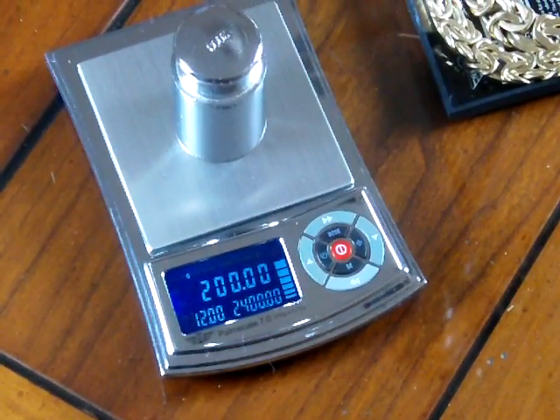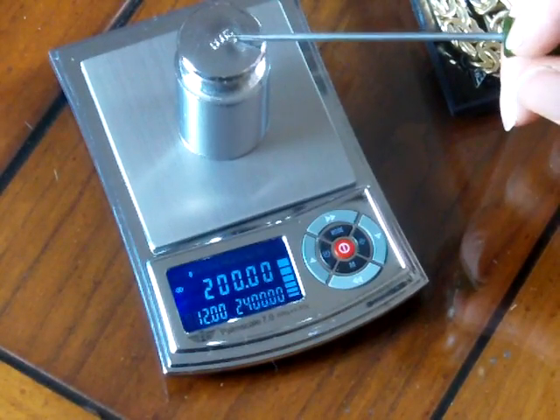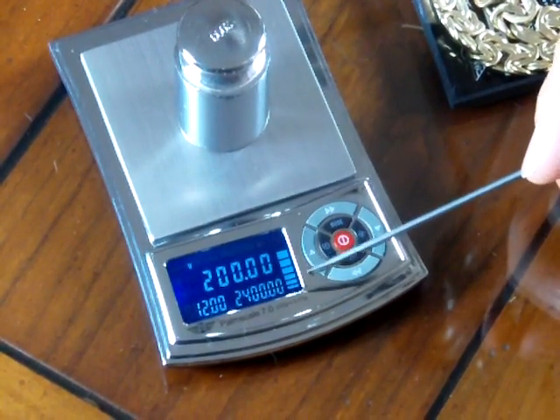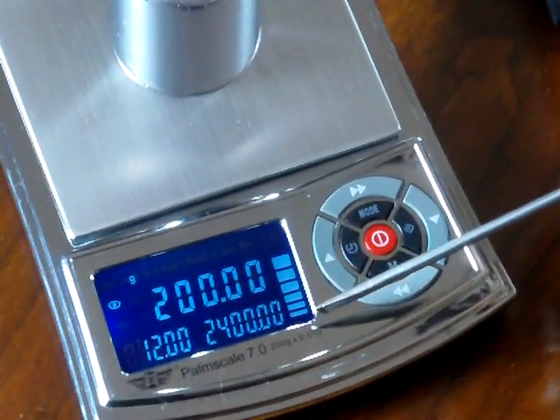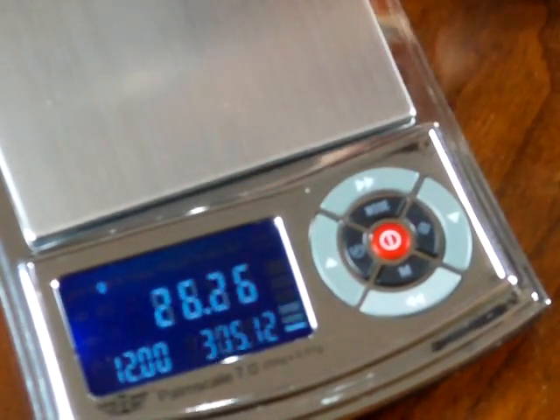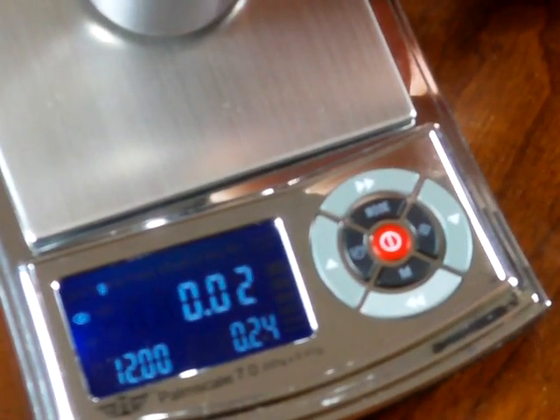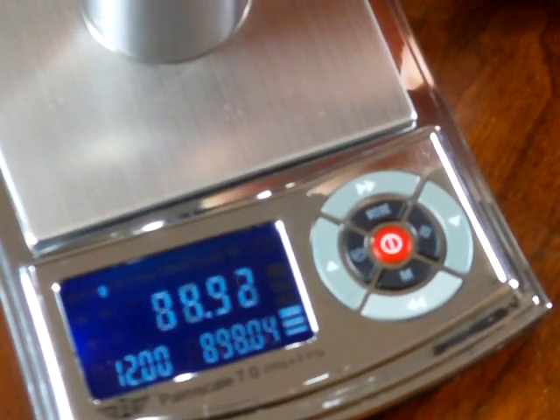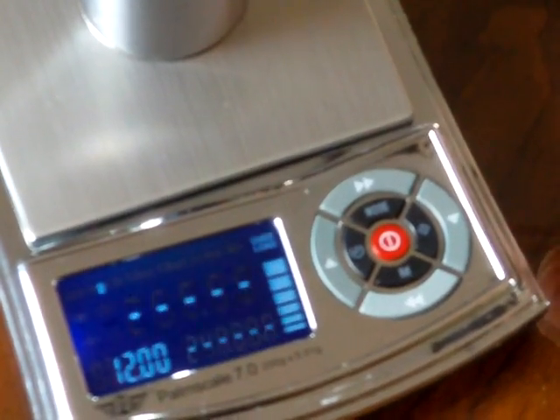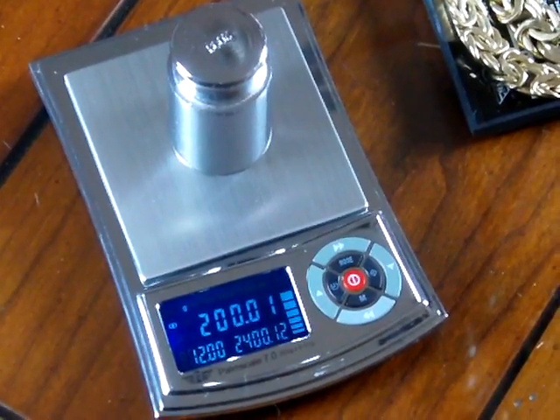There's nothing wrong with the scale — it just needed calibration, because if I apply just a little extra weight, it goes to overload. Now I want to show you the weigh meter. On the right-hand side of the display there's a weigh meter that gives you an idea of exactly where you are capacity-wise on the scale. If I take the weight off and then apply weight gradually, the weigh meter goes up on the right-hand side — up, up, up, all the way to 200. If you put too much weight on, you'll get overload, and putting too much weight on the scale will ruin the load cell.